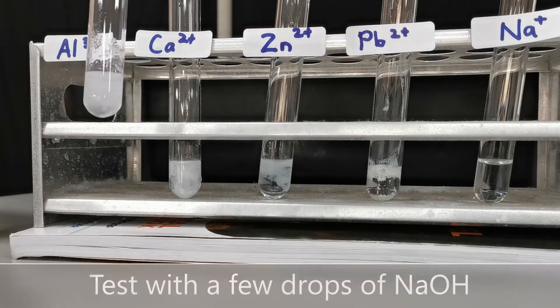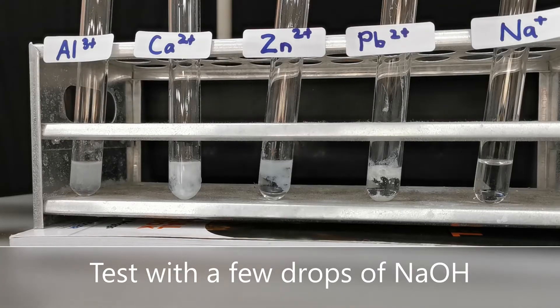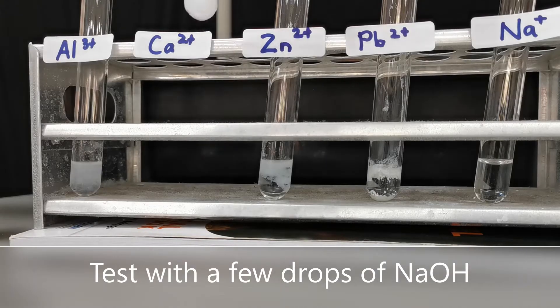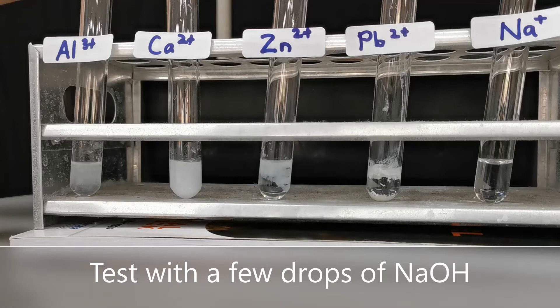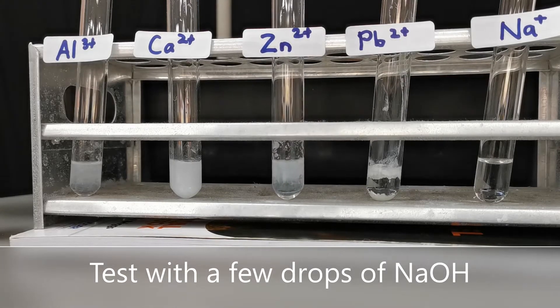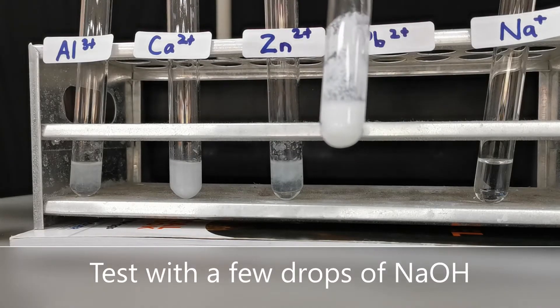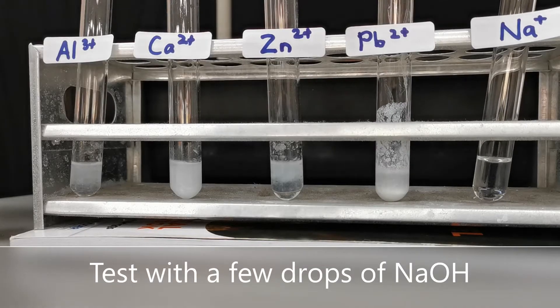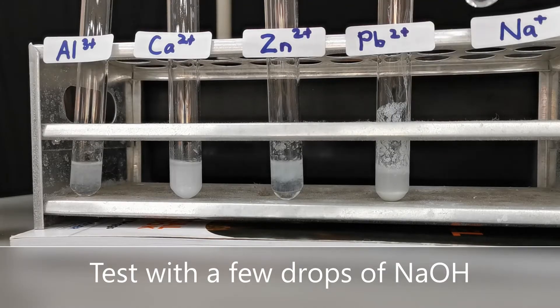In the aluminum solution, a white precipitate is produced — that precipitate is aluminum hydroxide. The calcium solution also produces a white precipitate of calcium hydroxide. Zinc also produces a white precipitate of zinc hydroxide. Lead also produces a white precipitate, but sodium does not produce any white precipitate.